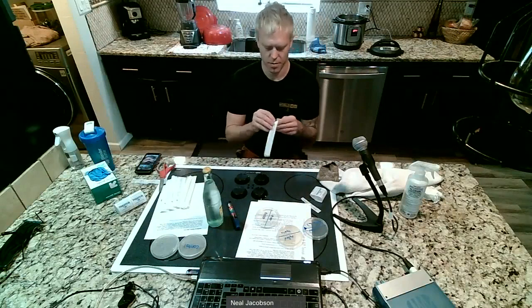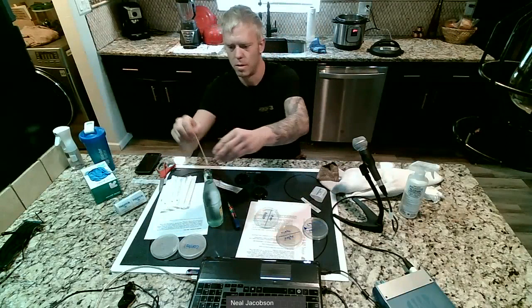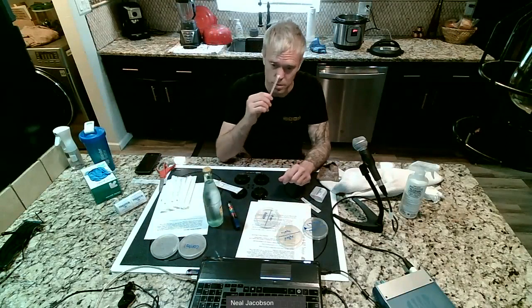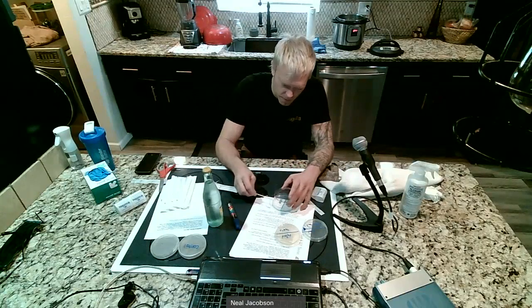All right, so now I'm going to check my nose. So take the Q-tip out, dunk it in the water, and then go all over the nose. So outside of the nose, inside of the nose, and I feel like I'm doing a COVID test. Okay. I might grow some COVID on my plate. No, that won't happen. And I'm going to lift up the plate.